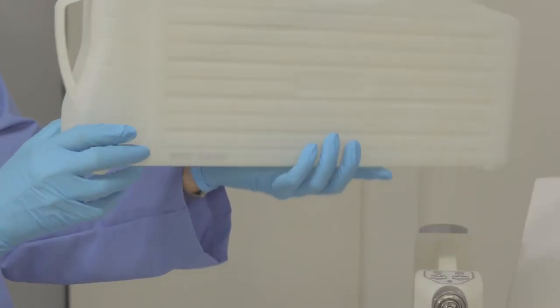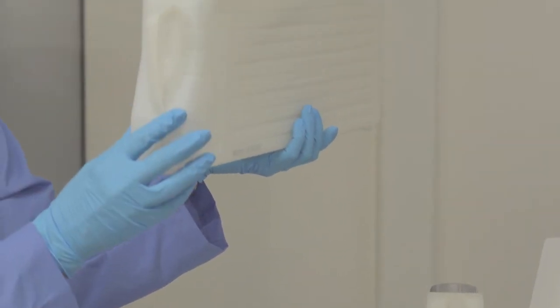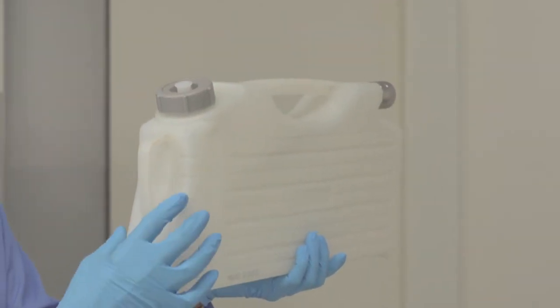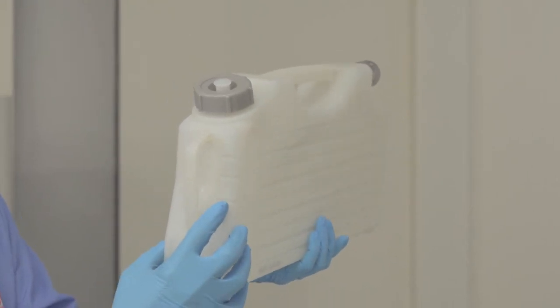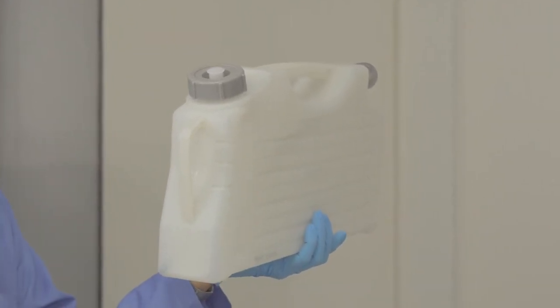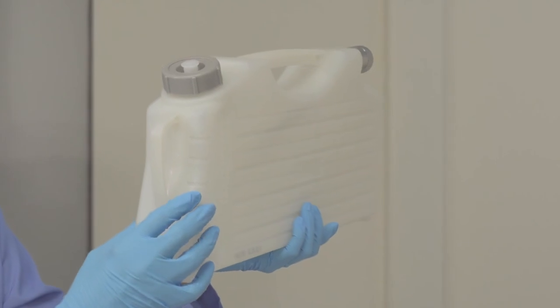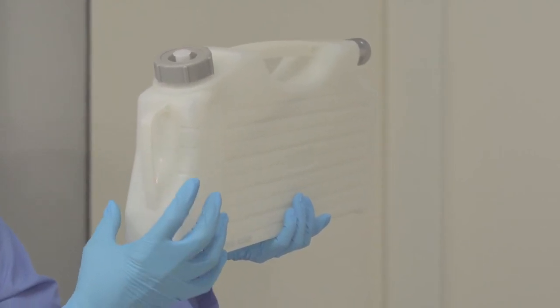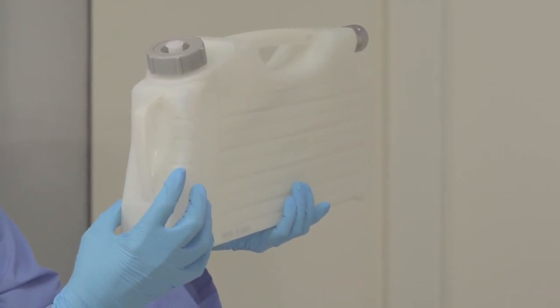It is best to have the fluids slightly above the markings to ensure that you will not receive low fluid notifications. If you normally process 300 cassettes or two baskets routinely, you can add one gallon, 3.8 liters, of reagents in each reagent container if you like.